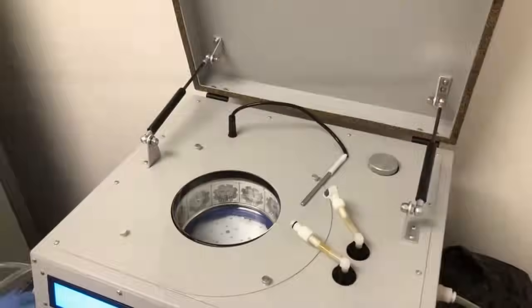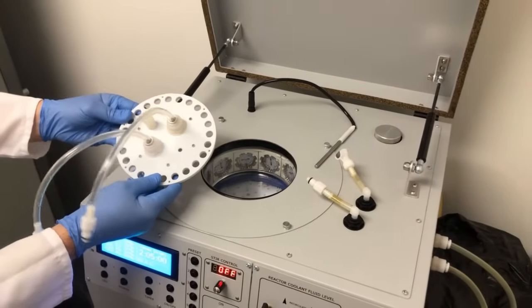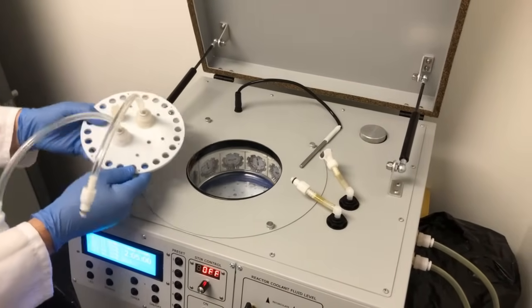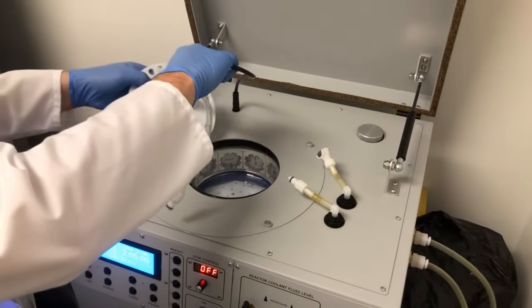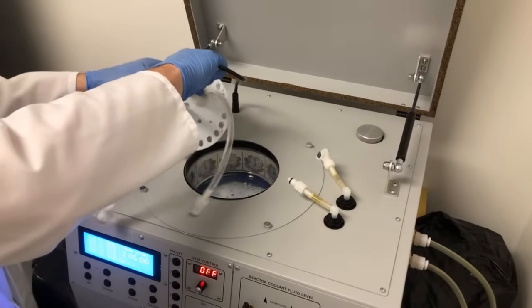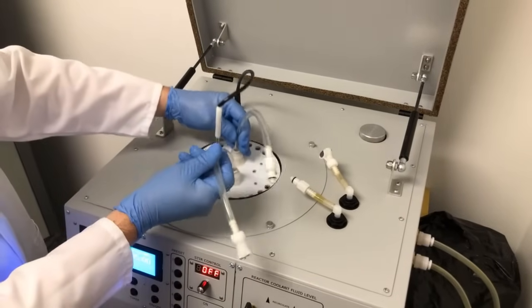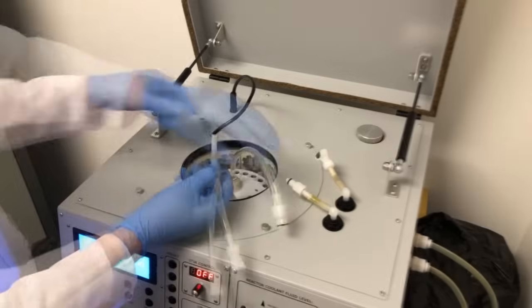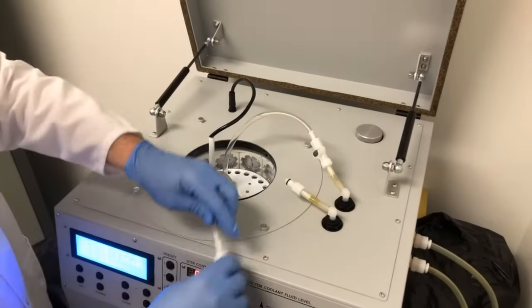Now that we've quickly covered the instrument panel, let's demonstrate setting up a reaction. For this example, we're using our two milliliter vial reaction vessel, which is a typical setup for parallel photochemistry. Once we connect the temperature probe and everything is situated, the reaction vessel gets inserted into the reaction chamber.